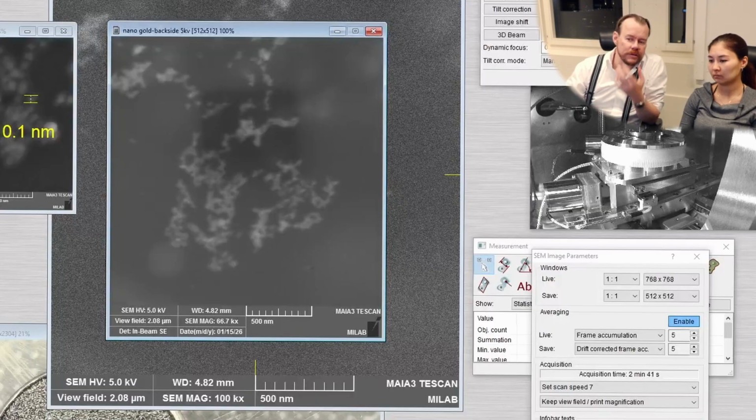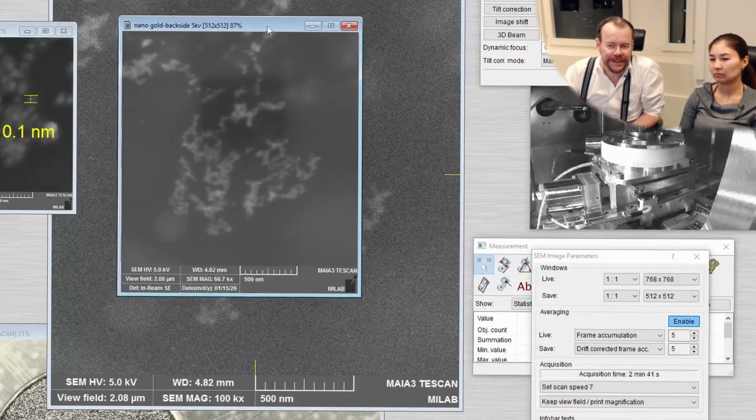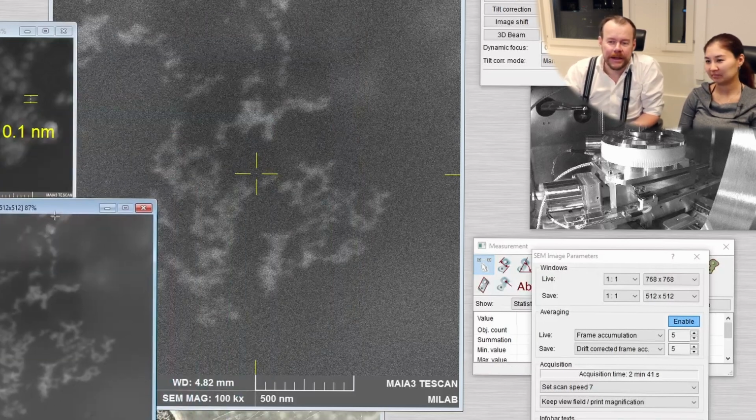So what I want to show here is what happens when we drop the voltage. So now we have already dropped the voltage to 5 kilovolt. We still see the particles, but they are a little bit more blurred because they're on the back side. So resolution-wise, it's not advisable to look through a window when you can go to the other side of the room, so to say.